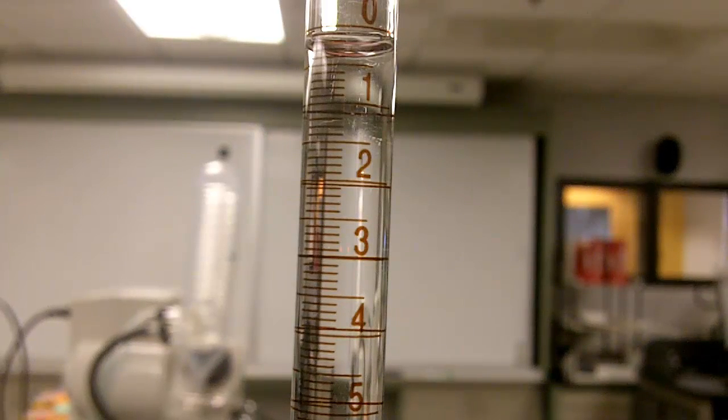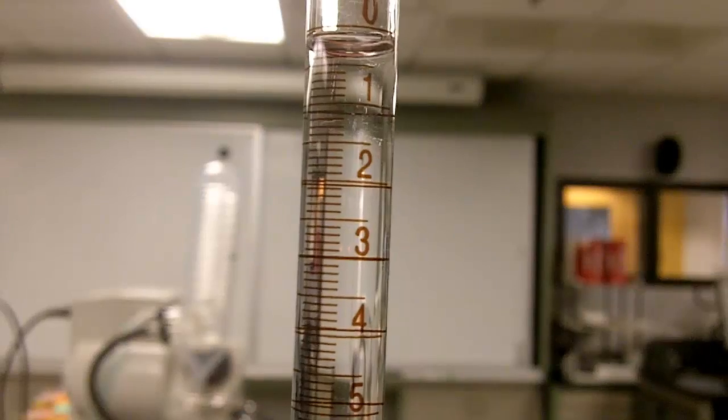So we need to remember 0.21 as our starting volume. Now if we were to dispense some of this out, let's go ahead and do that.